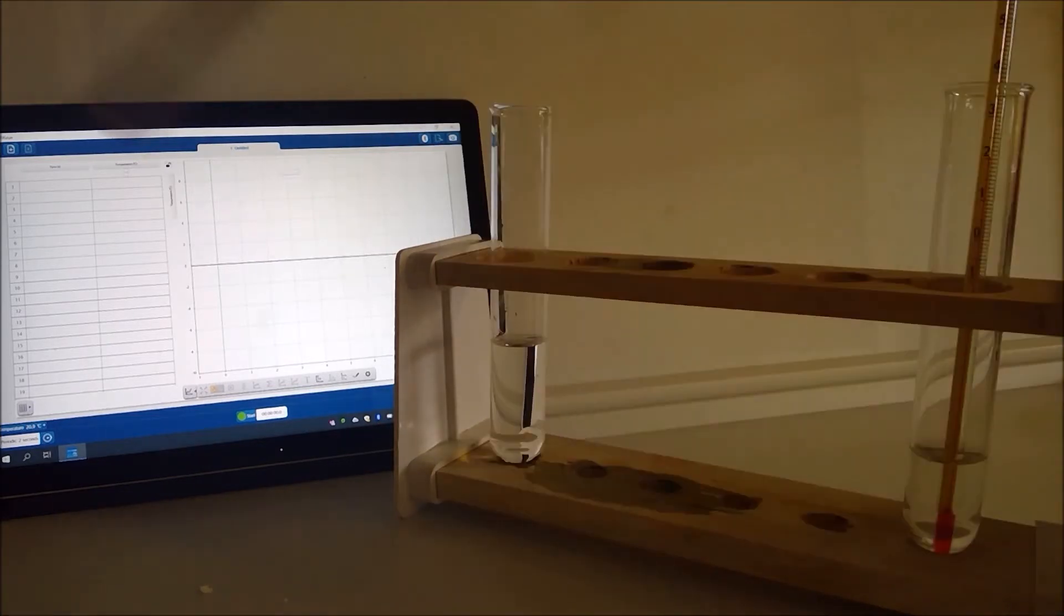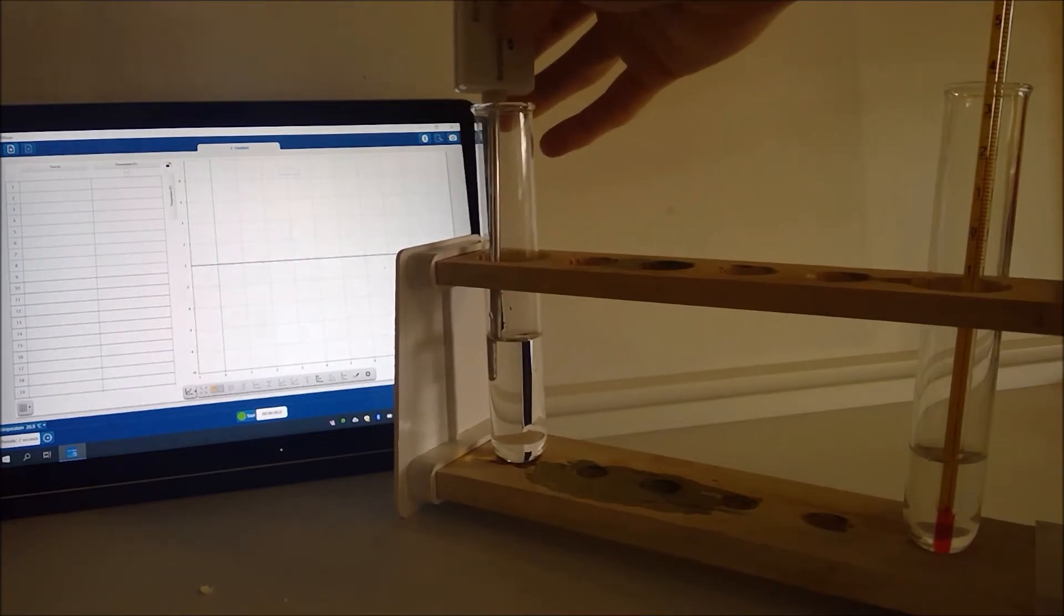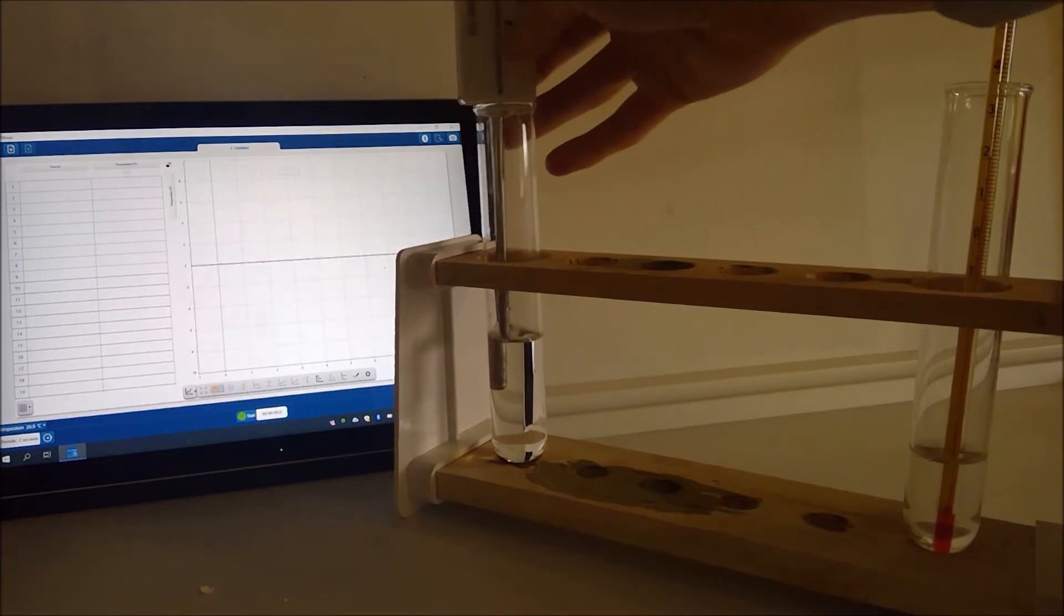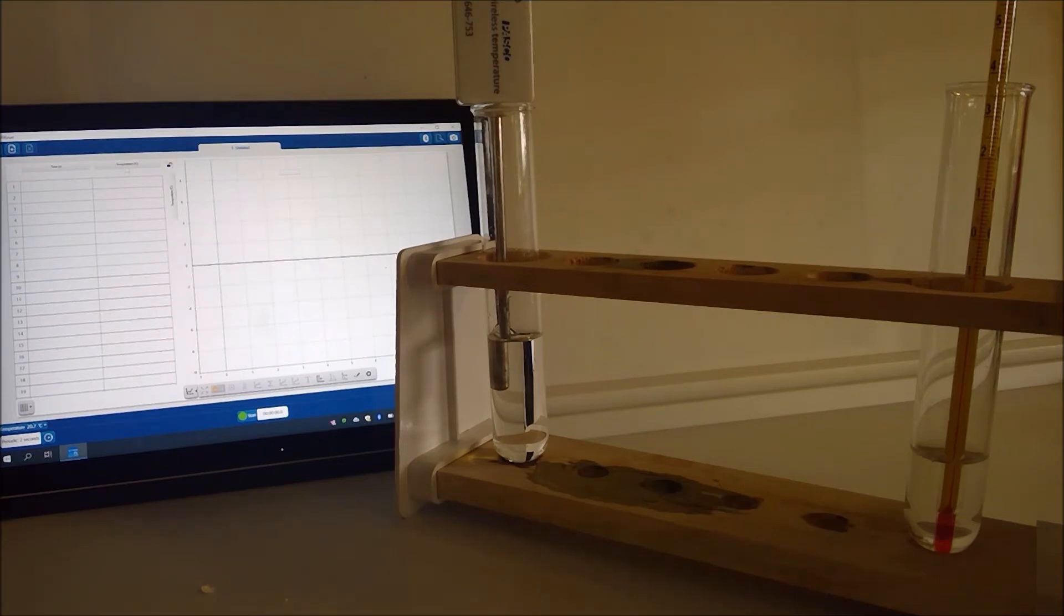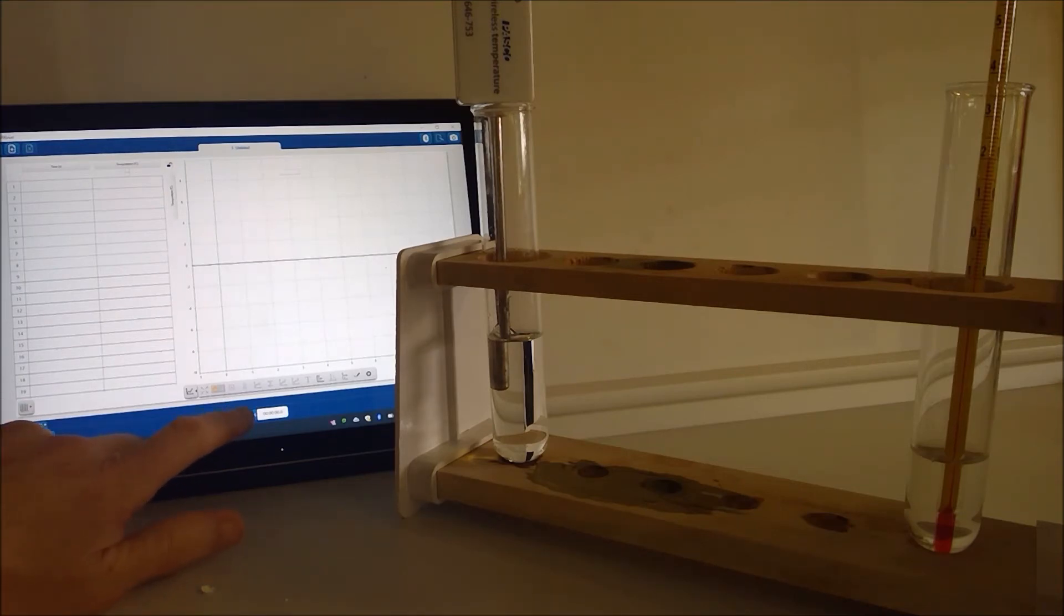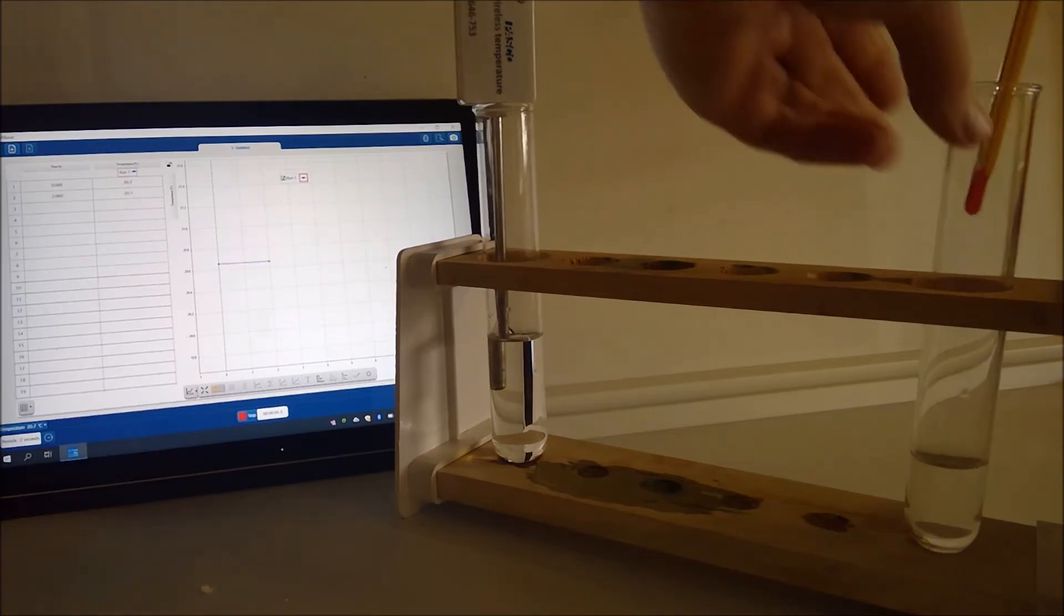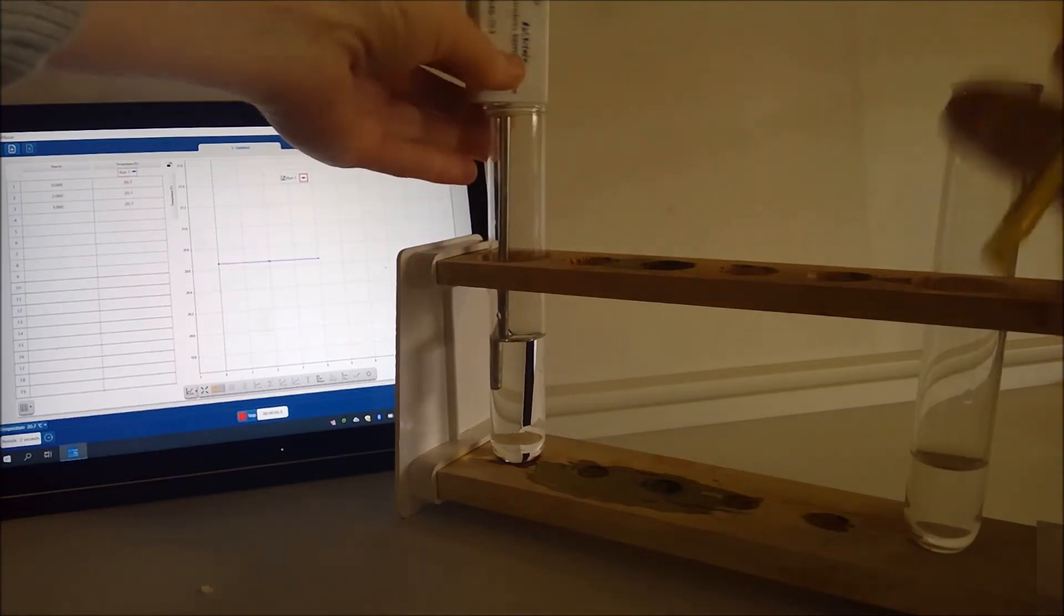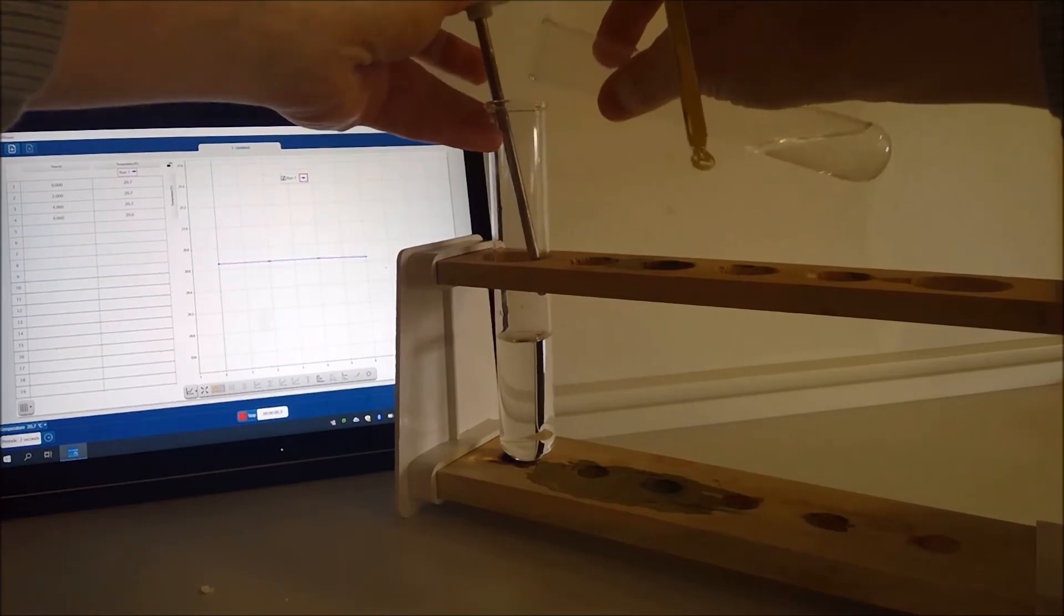Okay so if I pop that one in there I'll have to lift it out slightly as I pour the other stuff in just so we don't pour it all over. I'm going to start the recording there and then we will pour these in.